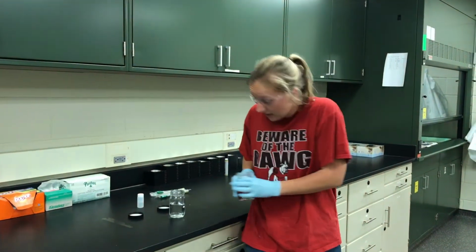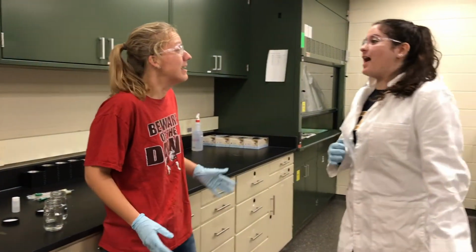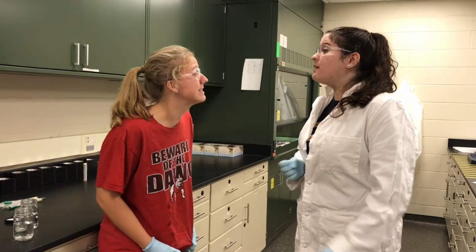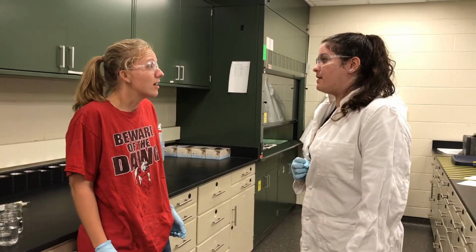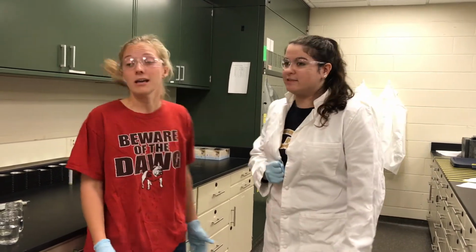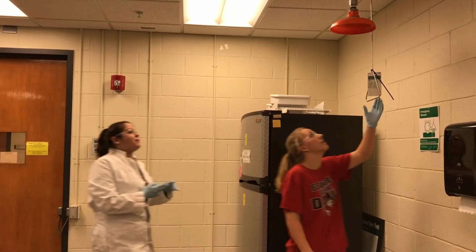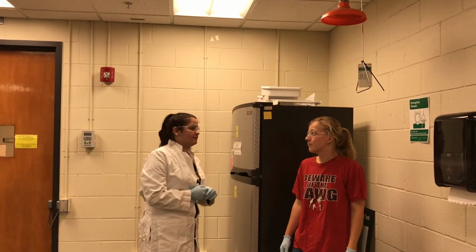Let the dogs out. Oh no! It's on me! I don't know what to do again! Help! It's okay. Accidents sure happen to you a lot. My shirt! It's ruined! Your shirt? What about your skin? You know, if you'd been wearing a lab coat, this wouldn't have happened. What do I do? We need to go to the safety shower. Okay. Wait. You need to take your clothes off first and then shower for 15 minutes. Will you count for me?